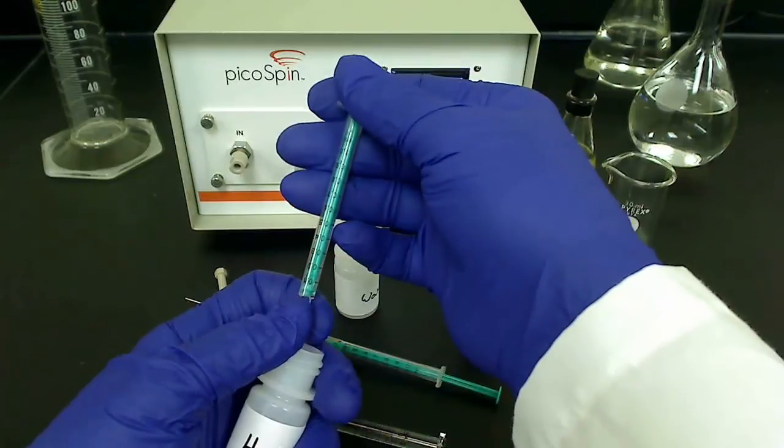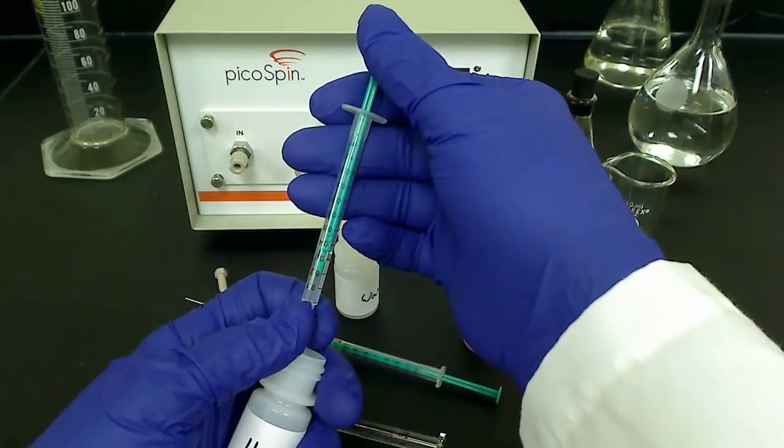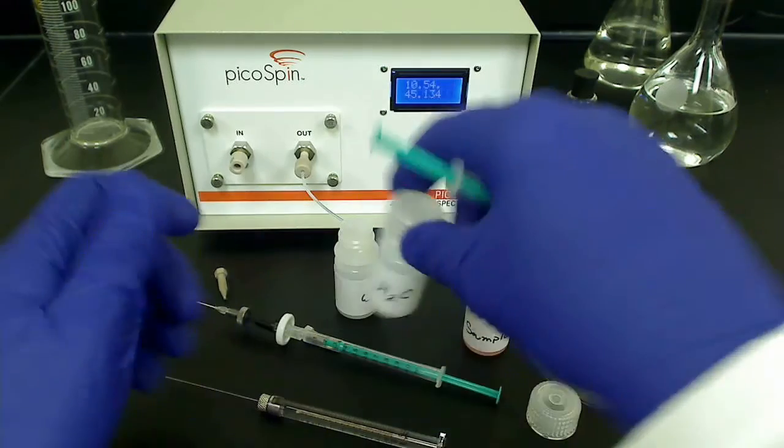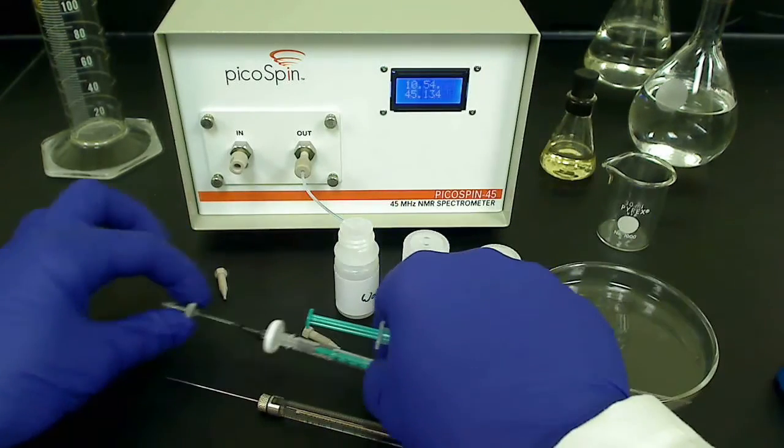We can remove or leave attached the inline filter and cap the inlet fitting. Finally, seal the waste bottle, remove the drain tube, and cap the outlet fitting.